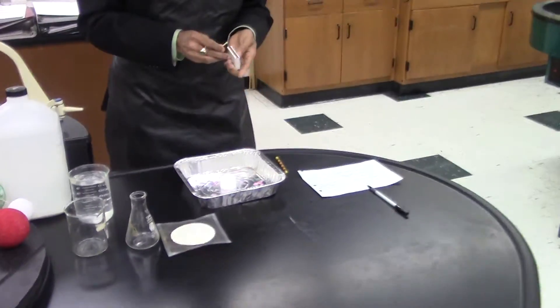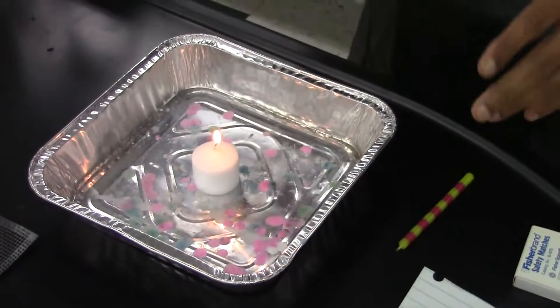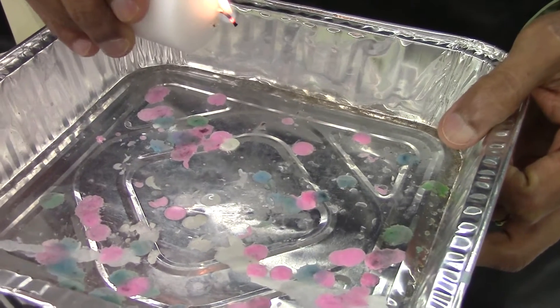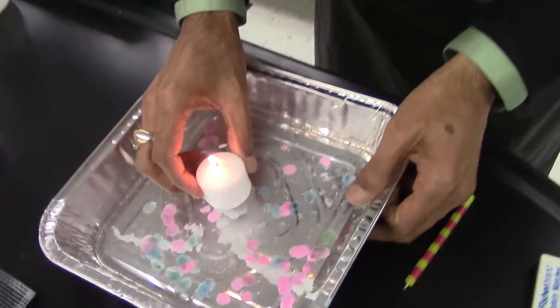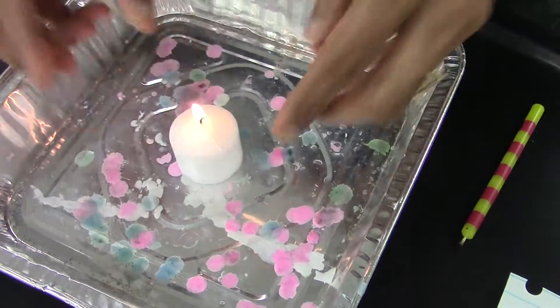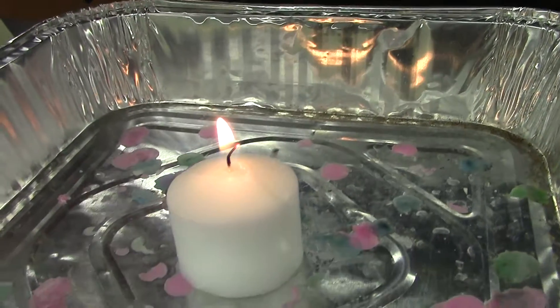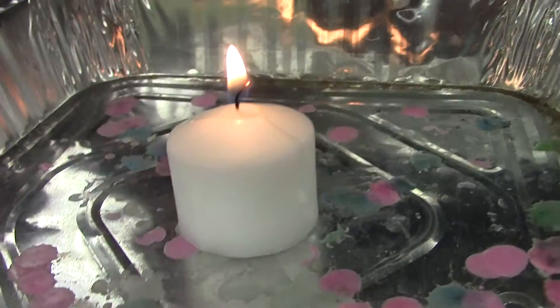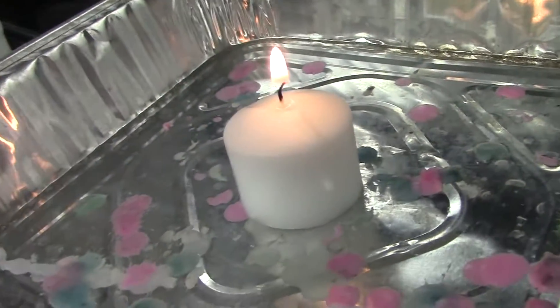I'm going to light a candle. We have a flame. You can see some fumes coming up. So we have a burning candle. I'm going to get a few drops of the liquid wax and get it stuck on the inside. If you observe closely, you can see different parts of the flame. The majority of the flame tends to be orange in color. You can see the wick is burning and it's turning dark, turning black. You can see melting of the candle — some physical changes occurring. And of course, we are burning the candle wax, so that's a chemical change because you're producing substances that were not there before.